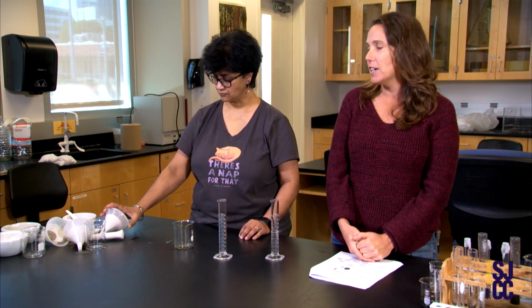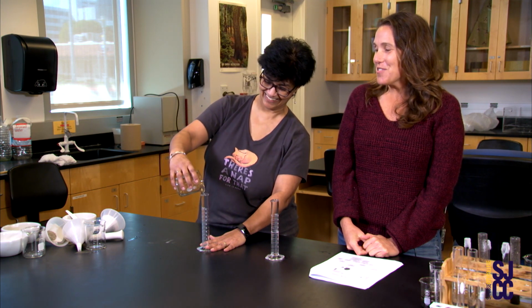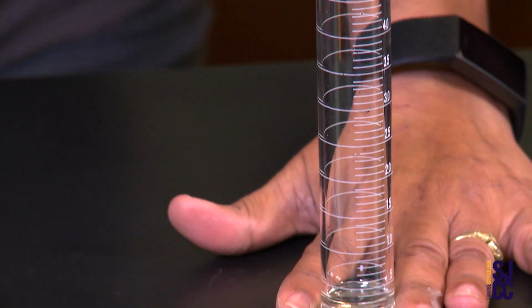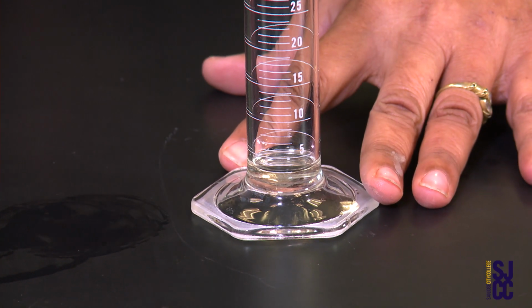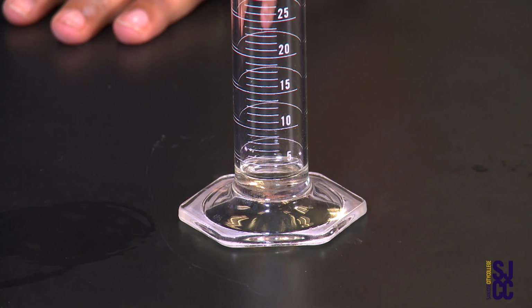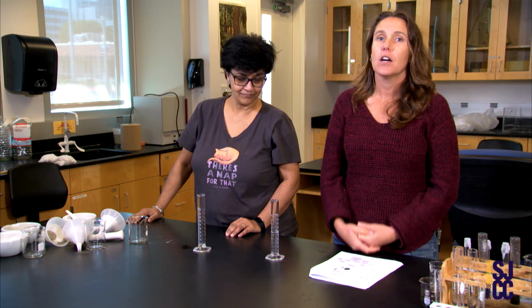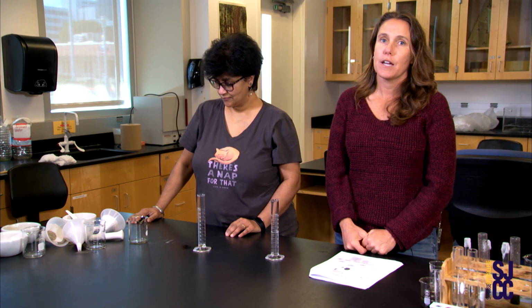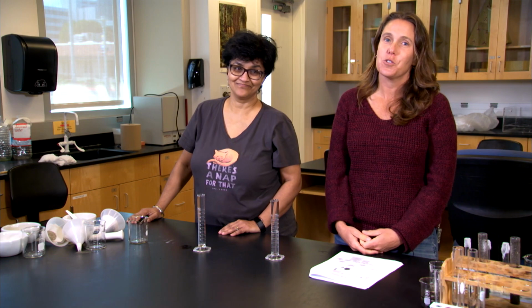So again, Sanhita is going to measure out how much water was retained in our topsoil. All right. Yeah. So that is, I'd say 3 over here, so 27. Okay, so 3 milliliters of water was able to leach out, and our soil basically held or retained 27 milliliters of water, which is great for the plants to absorb and utilize for growth. And there you have it. We did the chemistry and physical analysis of soil.